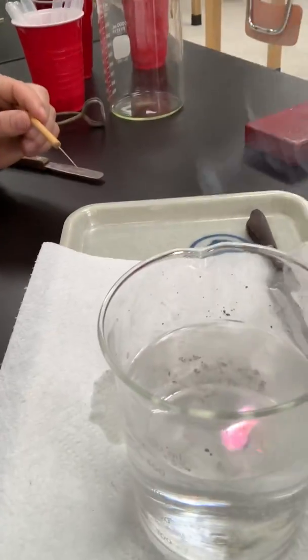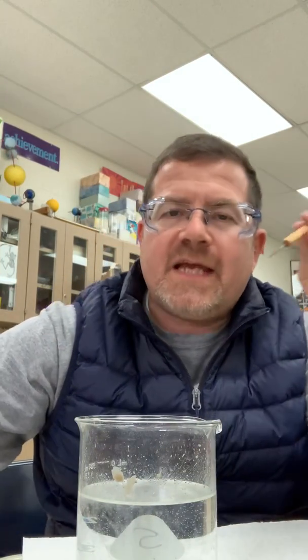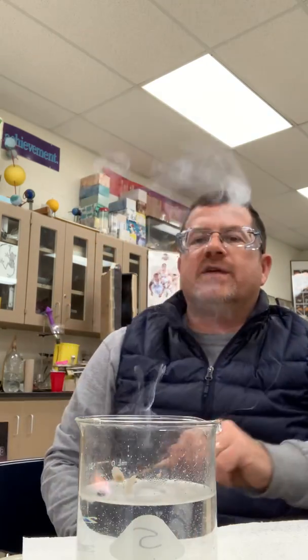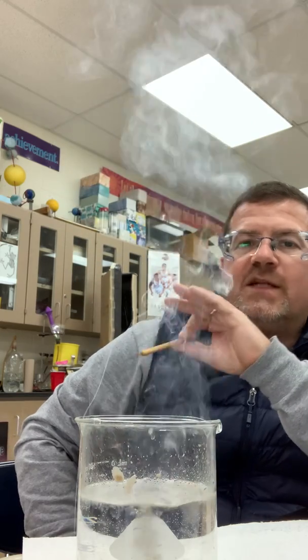And again, almost immediately. Another thing that's pretty darn cool is that it's also burning with a characteristic color. All metals give off a characteristic color. When you think about fireworks, for example, fireworks are different metals burning. They all have a characteristic flame color. I don't know if you can catch this one or not, but if you look at the color of the flame really carefully, you see an orange, which is always there for a flame, but you'll also see something that looks almost like a pinkish purple.